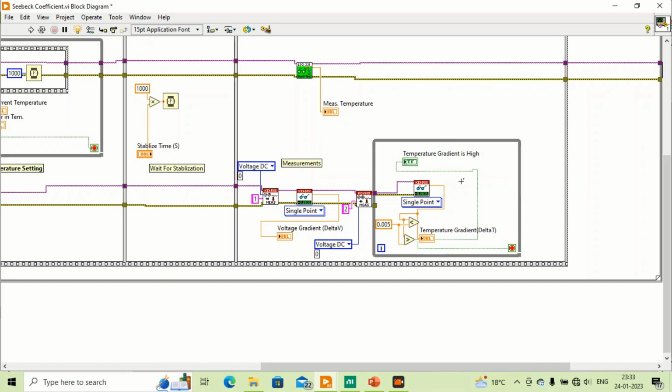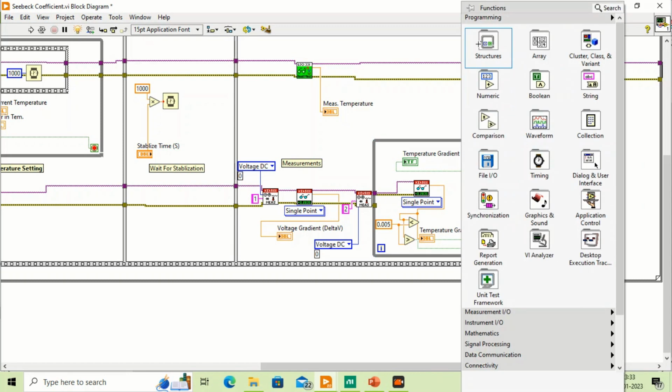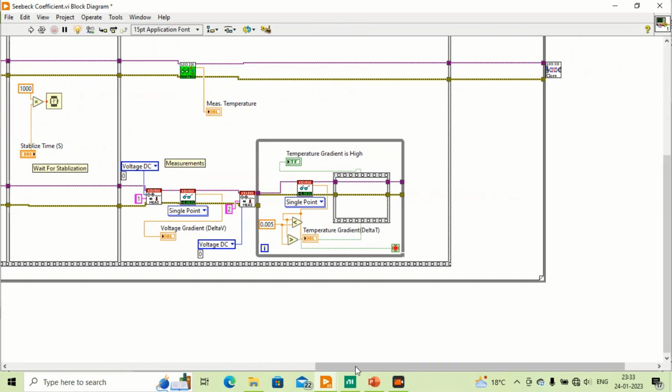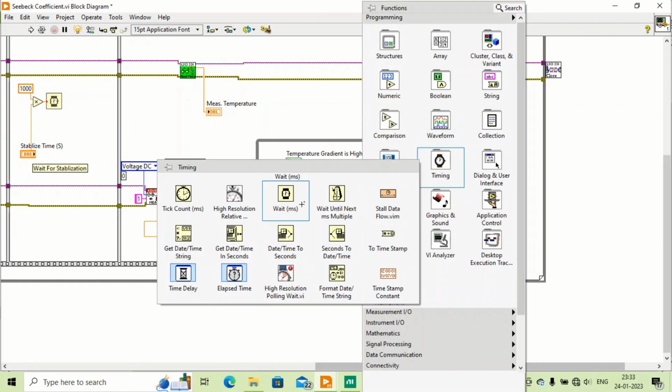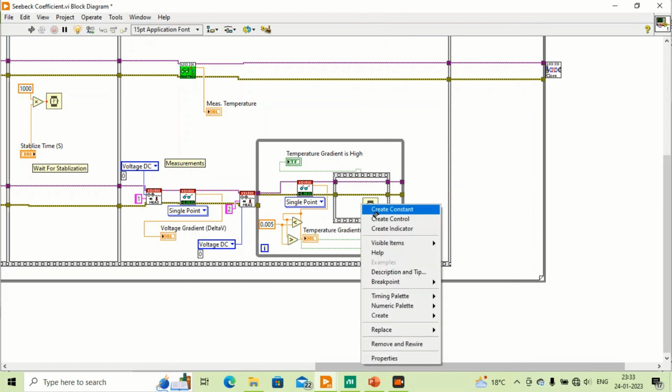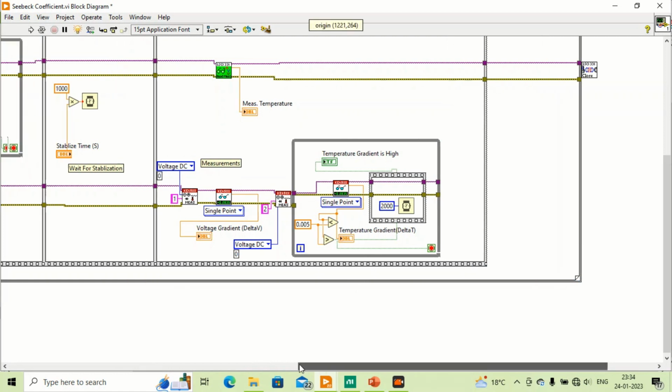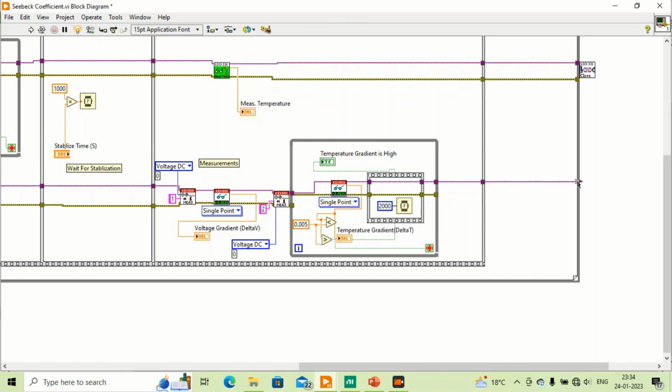And again, we can make something to wait for some time, to reduce the temperature in the thin film heater. Here I will wait for 1 second, say for 2 seconds. Okay, so this thing has happened. These things are okay for the multimeter.